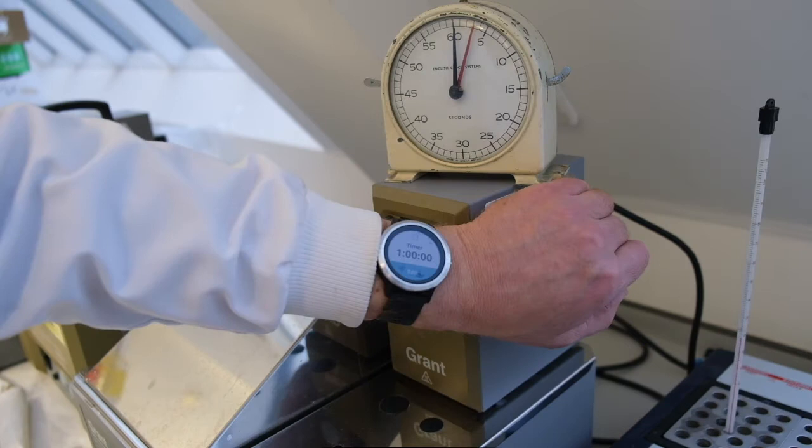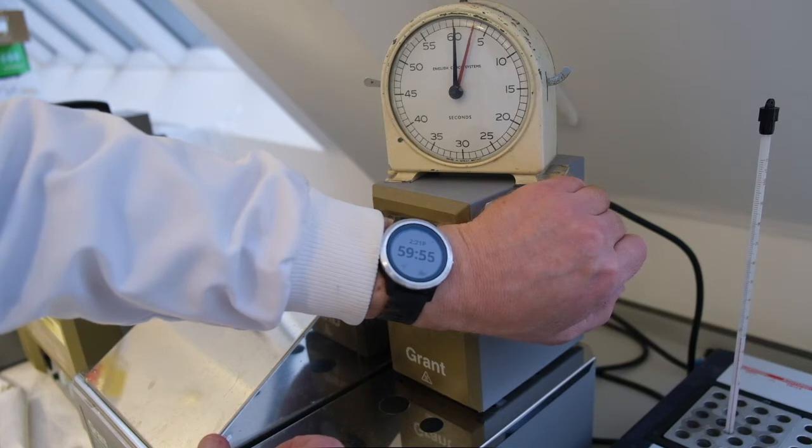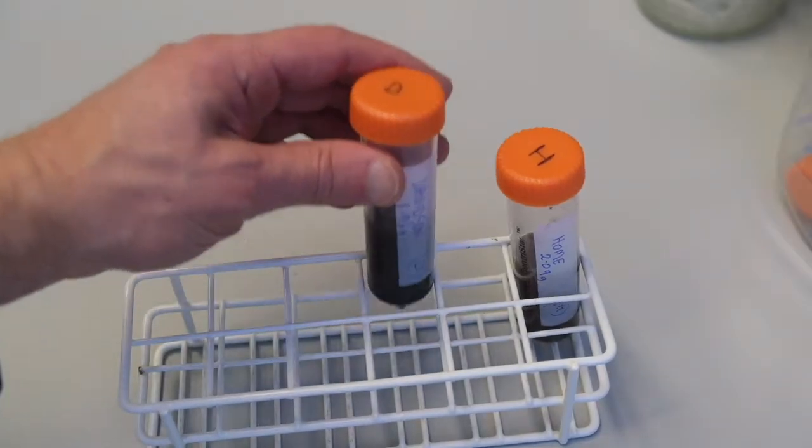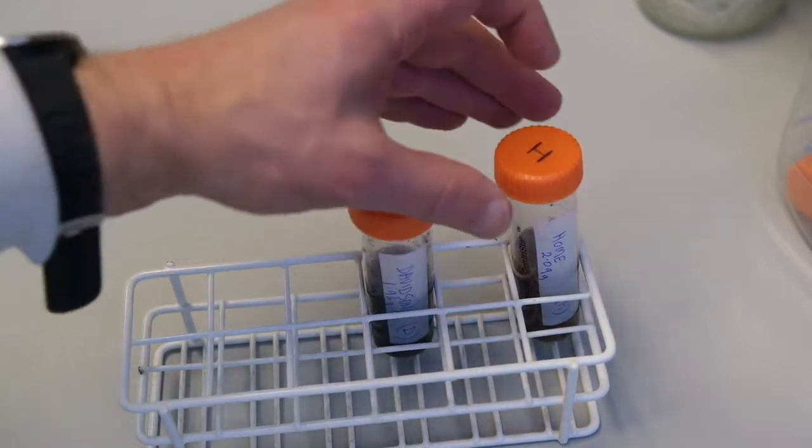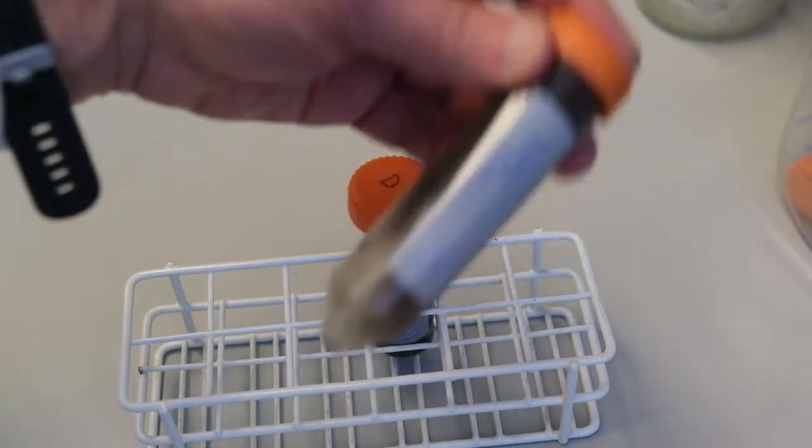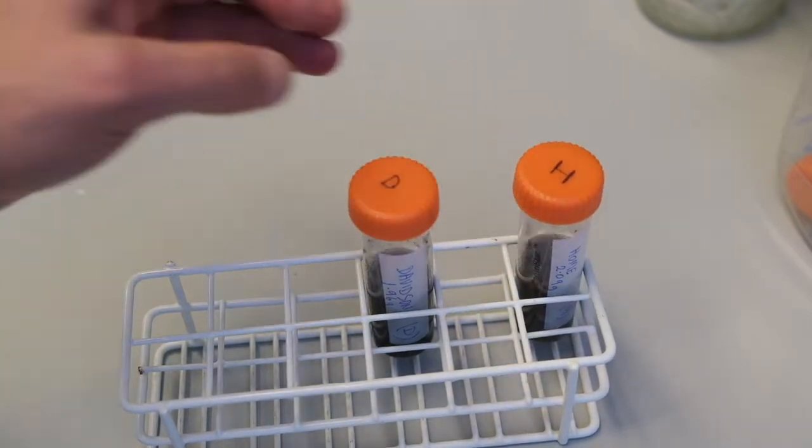My old-fashioned timer seems to be broken, let's try using modern technology instead. You can mix your tubes halfway through the incubation and place back in the 50 degree water bath for the remaining incubation time.